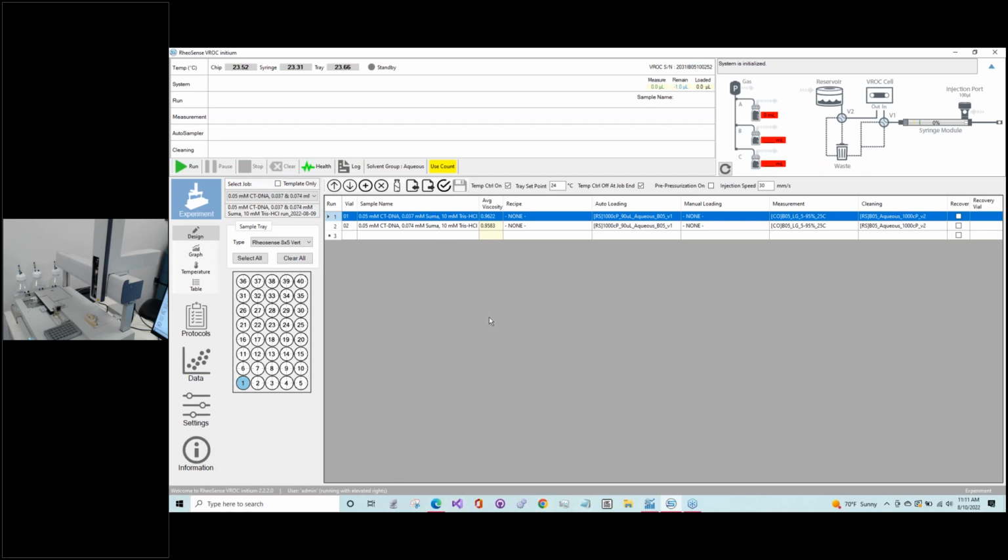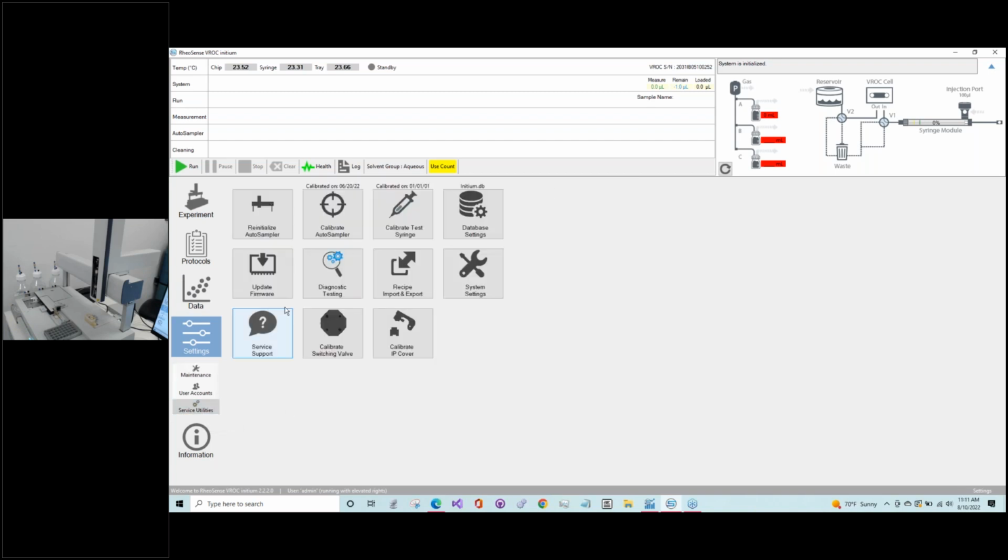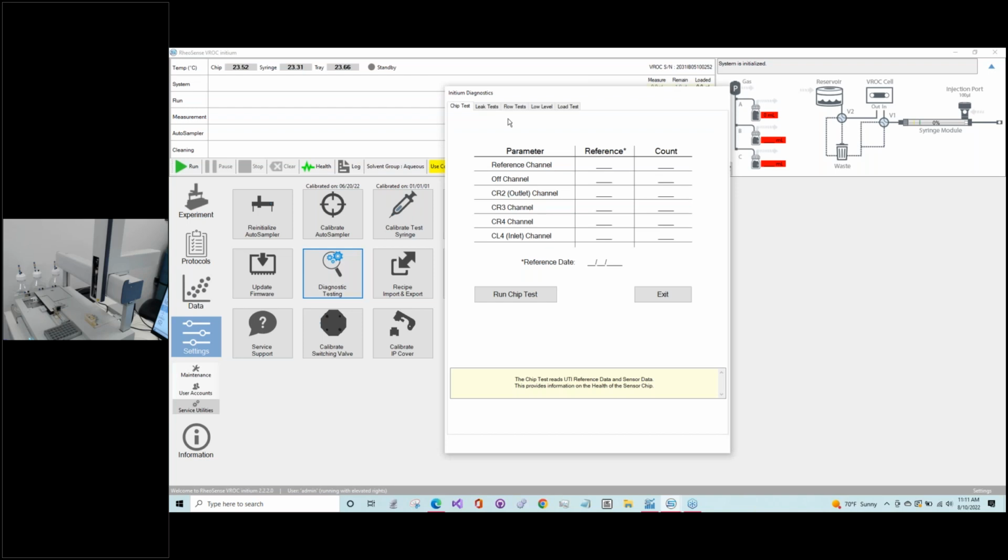So once all that is good, we are going to go through the diagnostic testing today. The diagnostics will run automatically before you start your test, but we thought today we would go through them with everyone so they get a better idea of how they work. To get to them on your own, you go to Settings, Service Utilities, and click the Diagnostic Testing tab, and then the screen will pop up. The first diagnostic test we do is our chip test. So I'm just going to hit run chip test. This test is double checking the sensors to make sure they're receiving proper counts and that they're working correctly. So let's see.